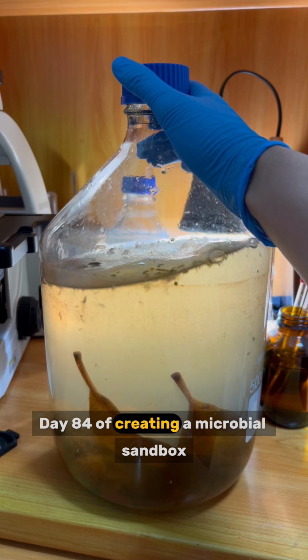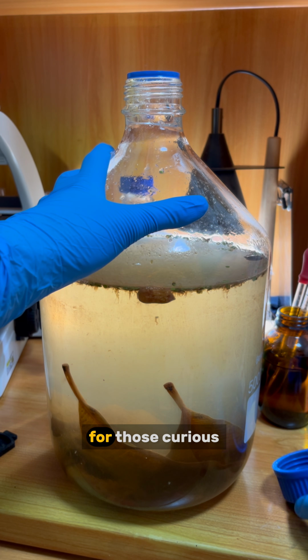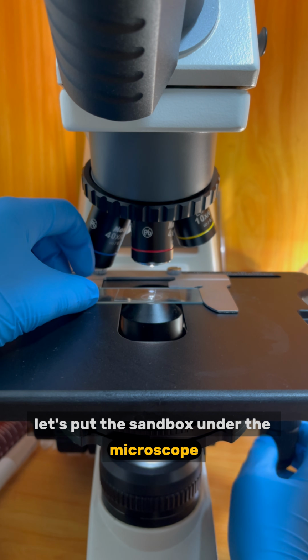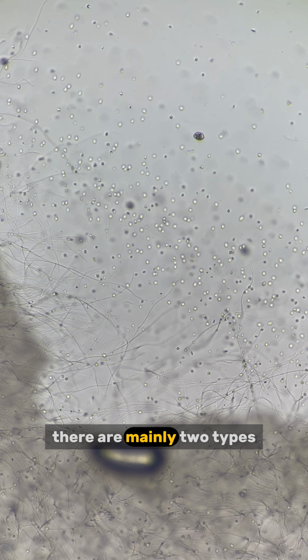Day 84 of creating a microbial sandbox by adding random stuff and observing it under the microscope every day. For those curious, the water bears are still alive in the paradise box, but their numbers haven't really increased. Let's put the sandbox under the microscope. Around the organic debris, there are millions of microbes. There are mainly 2 types.